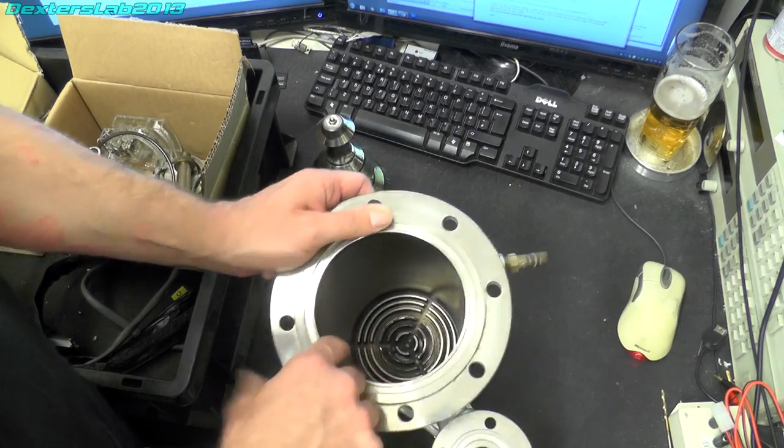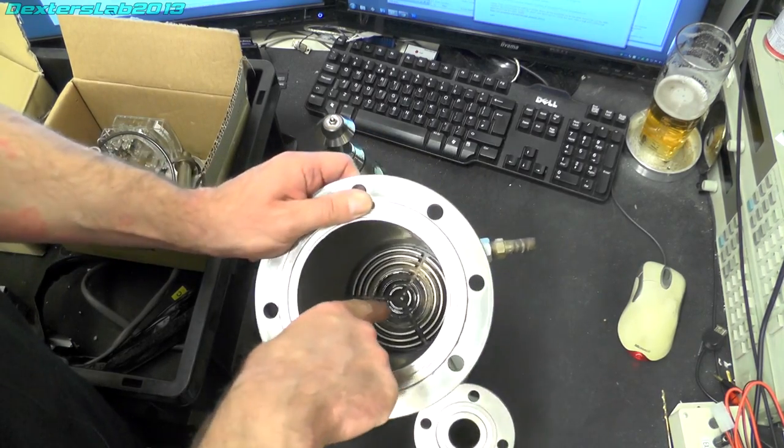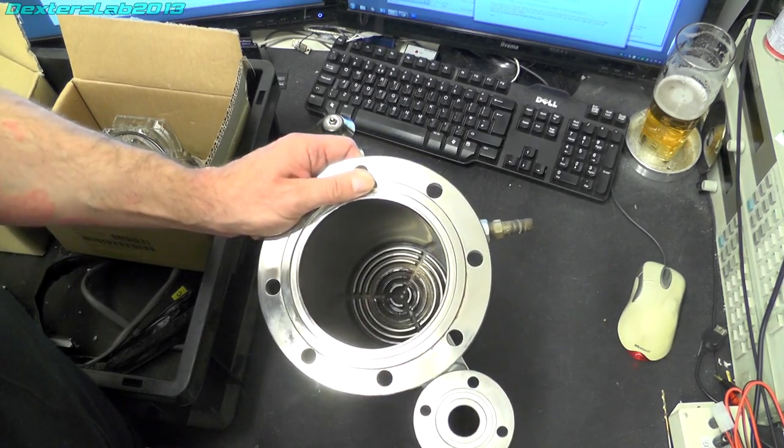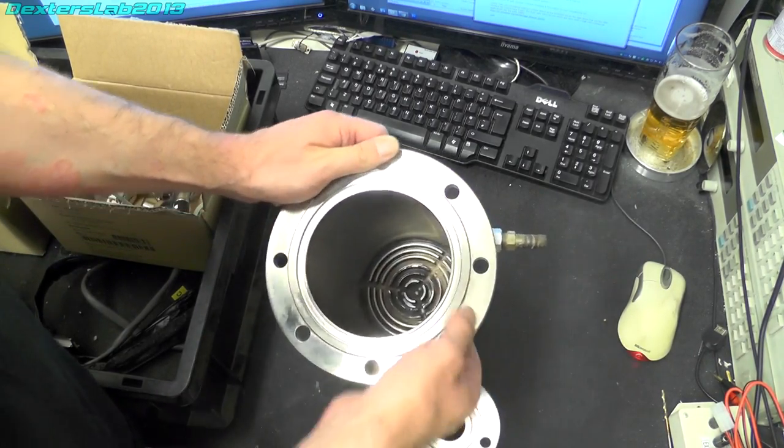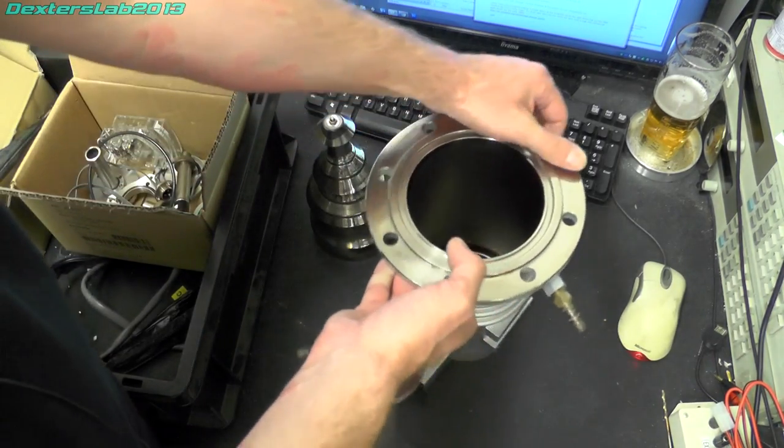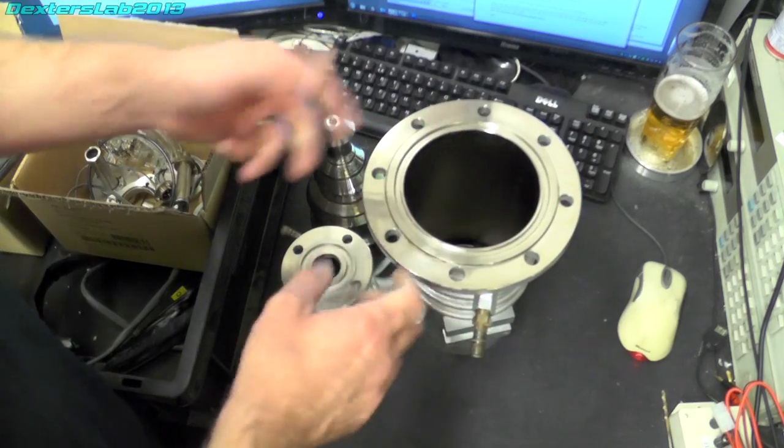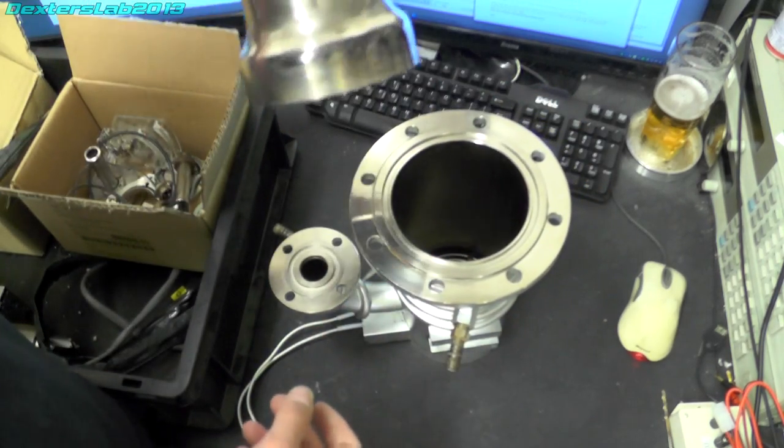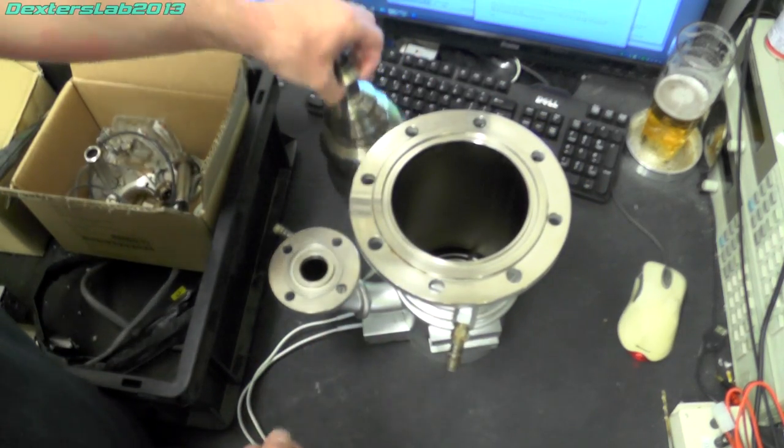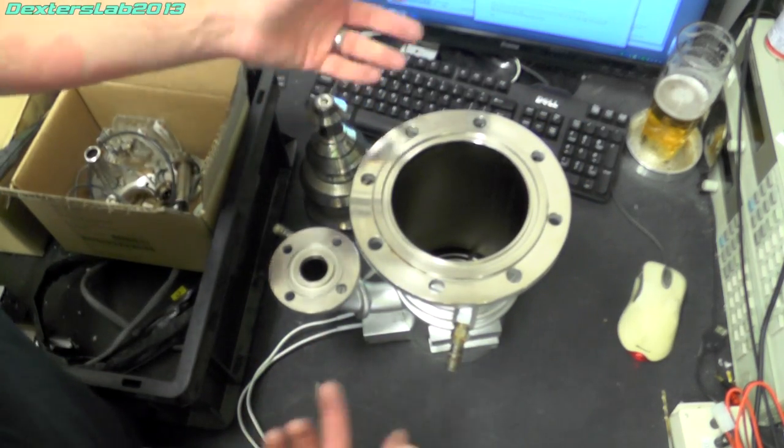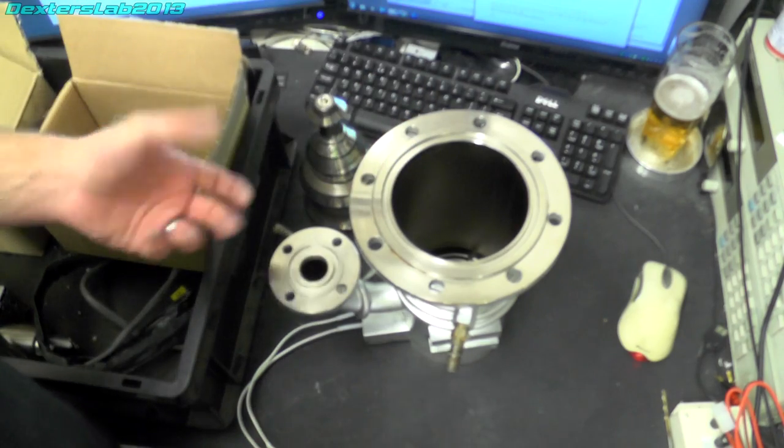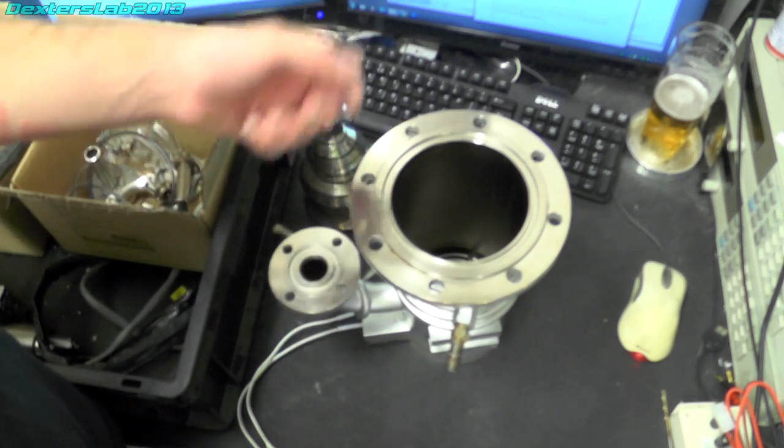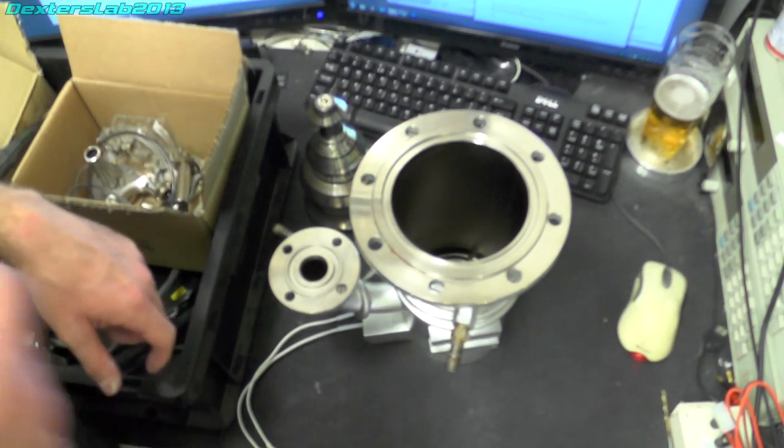And that makes the oil then condense on the side of the chamber, dribble back down into the bottom there where it's recycled. Really really simple design and very very reliable. Obviously the only thing to break really is the heating element and those are easily replaced anyway.